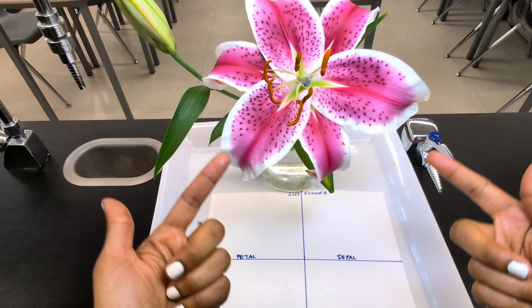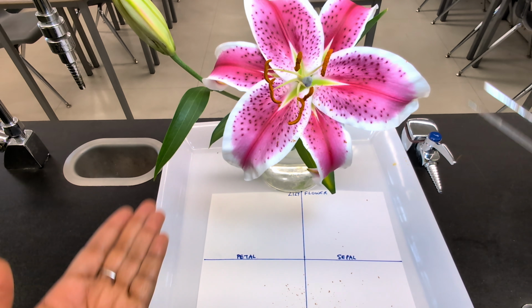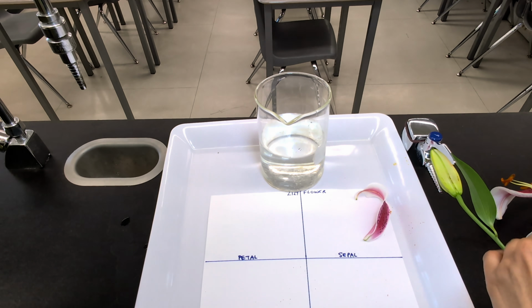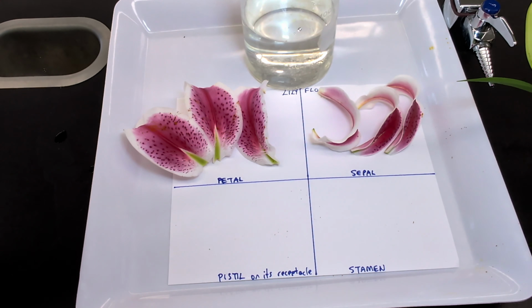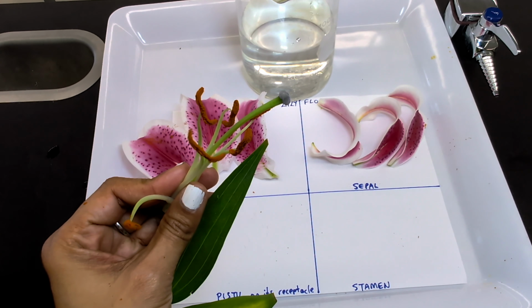Now, it's the colorful petals or tepals that help attract pollinators like bees with their bright color, and they also protect the flower when it is developing. So as we remove, we're going to place it on the paper. Gently pull off or cut each petal or sepal and lay them flat on your surface. As you saw, we have 3 sepals and 3 petals. These parts mainly serve to attract pollinators. Next, we are going to remove the male and female parts of the plant at the base.